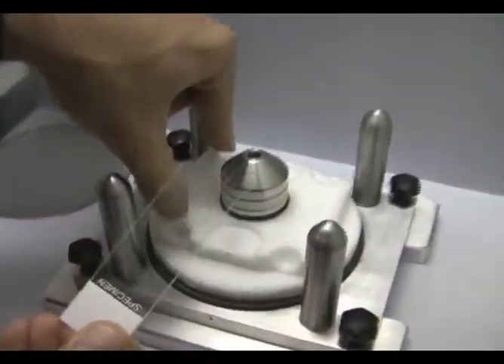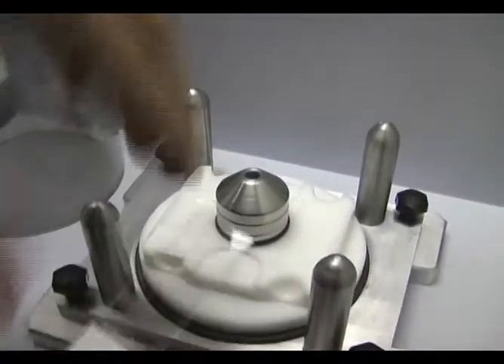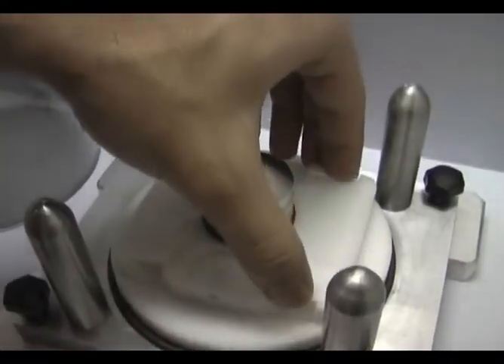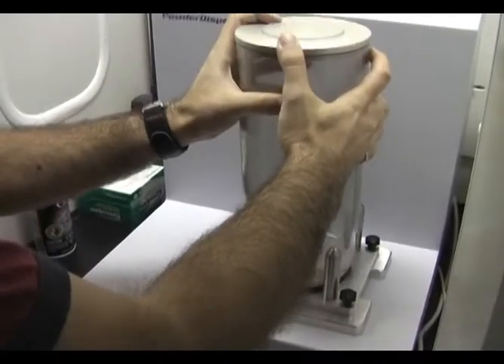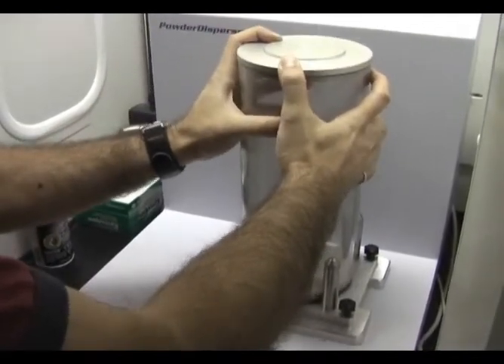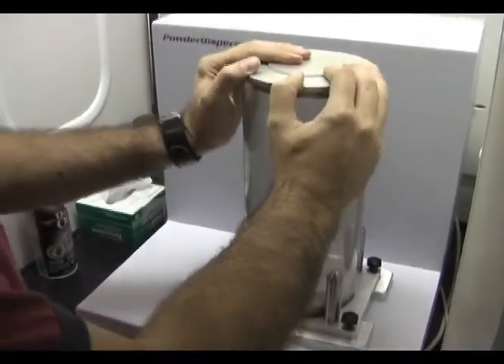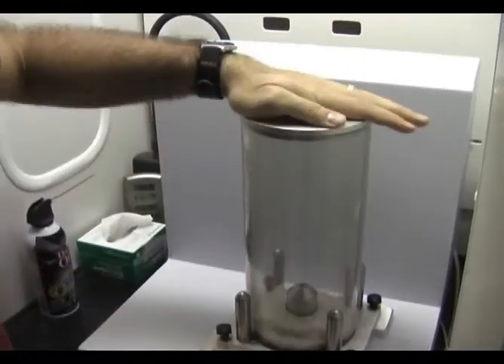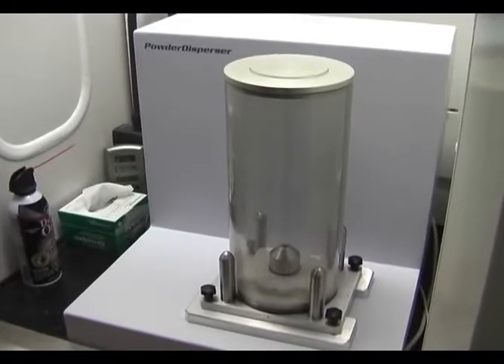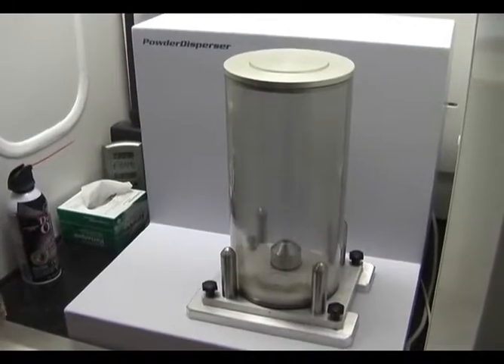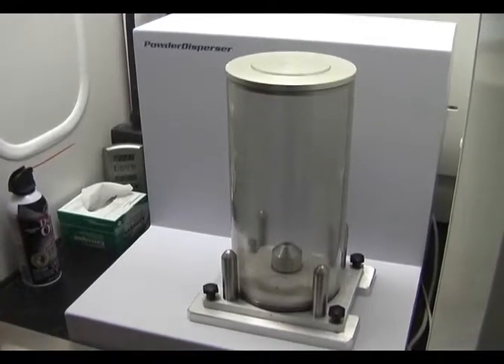You put your slides right on the side over here, and then you put the tube right on top. This is a compression fitting. You just have to make sure that it's tight enough. And now we're ready to run the software.